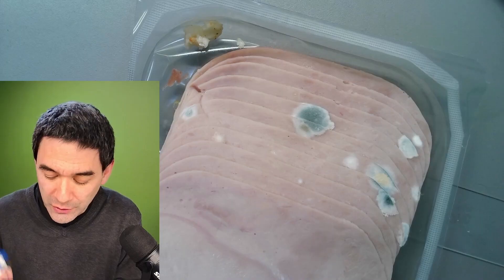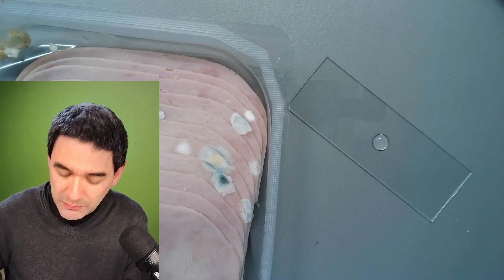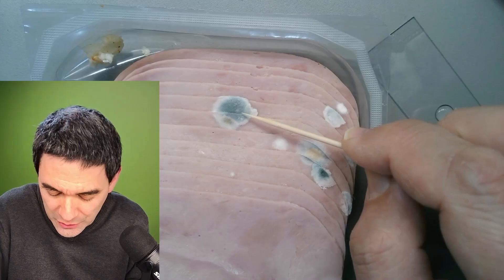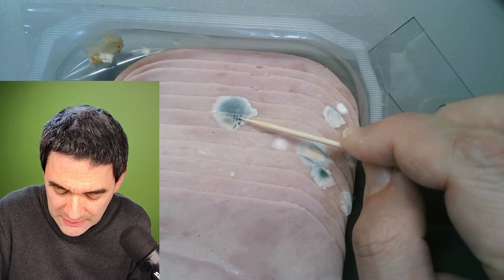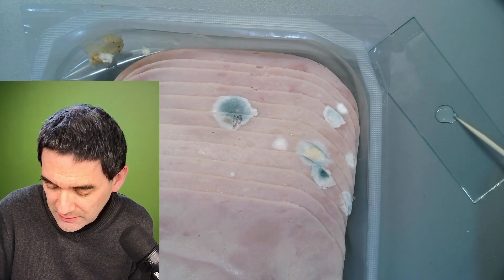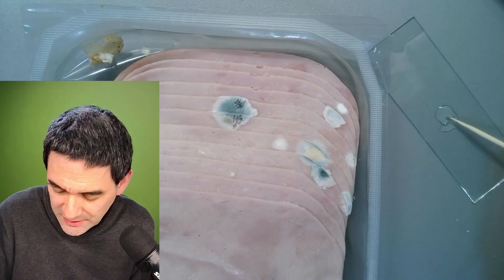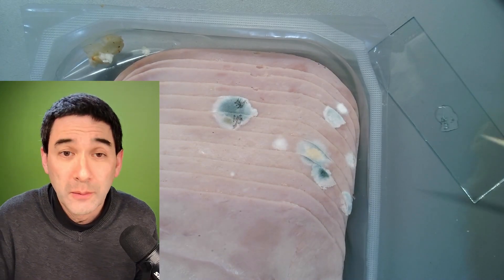A little bit of water first on my microscope slide. Then I'm going to try to take off a little bit of this fungus over here without touching anything. I have to make sure that the toothpick is also carefully disposed of. You can barely see something here — let's get it off. We're going to see how this looks like under the microscope. If we're lucky, we'll be able to find a couple of spores as well.